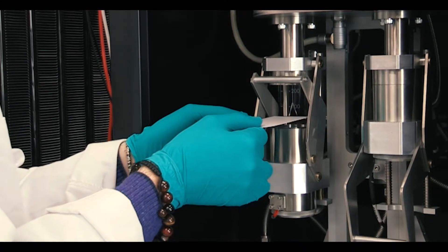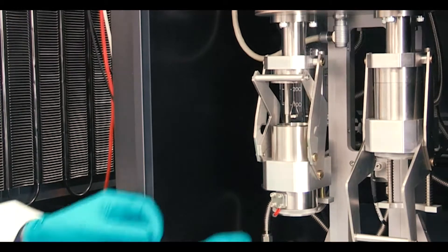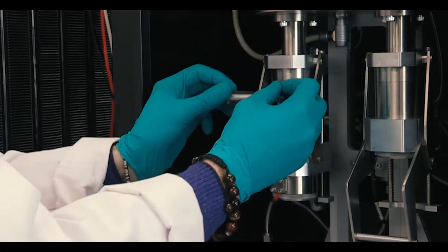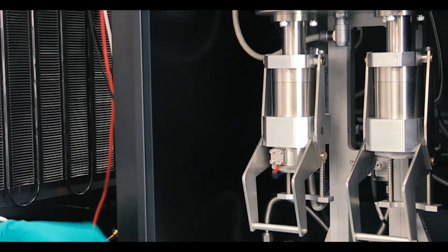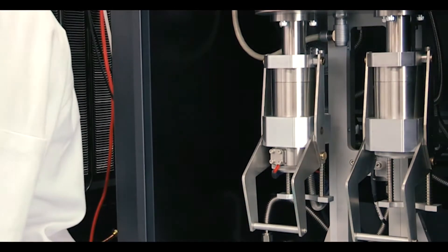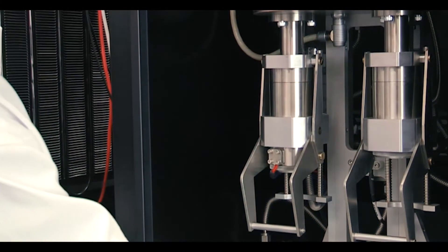When I know that the sample is nice and stable, I can close the chamber. I close the door of the system slowly, and I'm able to start my experiment.